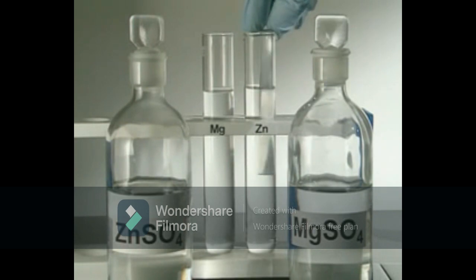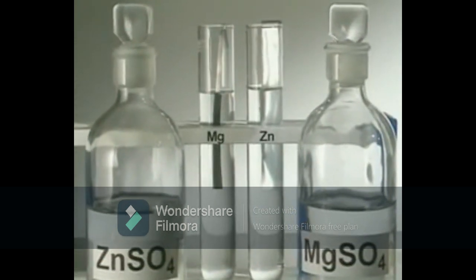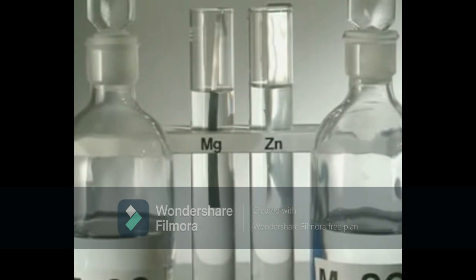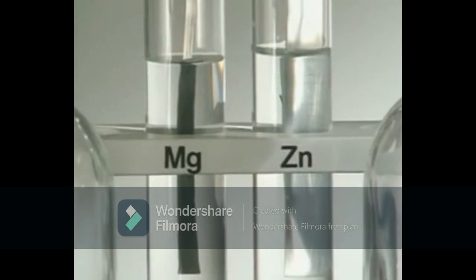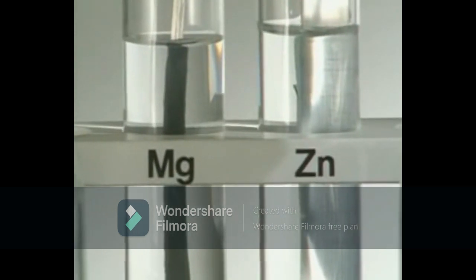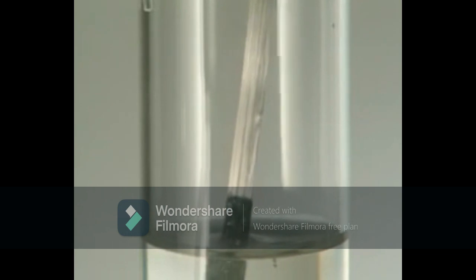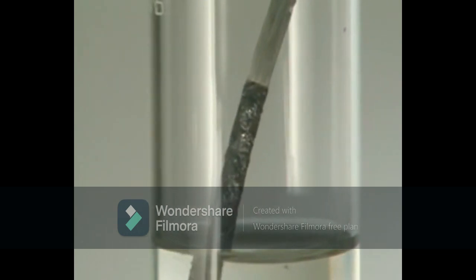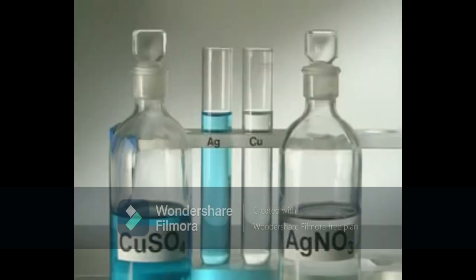Placing zinc metal in a magnesium solution and magnesium in a zinc solution will help determine which of these two is more reactive. Nothing happens to the zinc strip on the right, but magnesium reacts instantly, displacing the zinc from solution. Magnesium is the winner. It's the most reactive. But which is the least reactive?